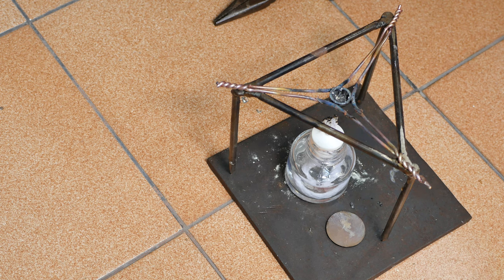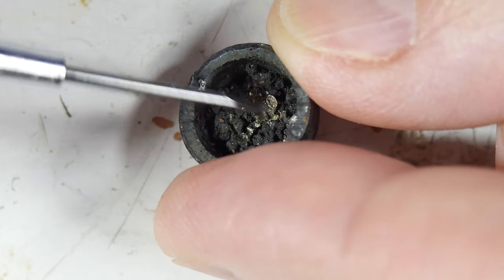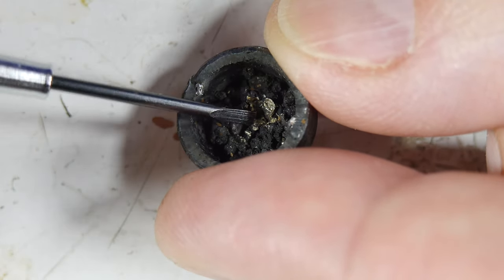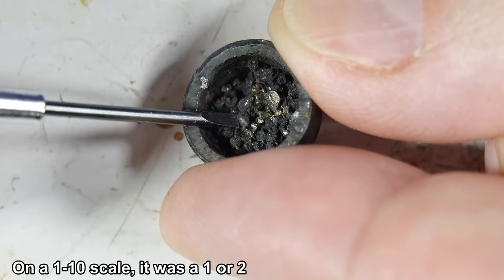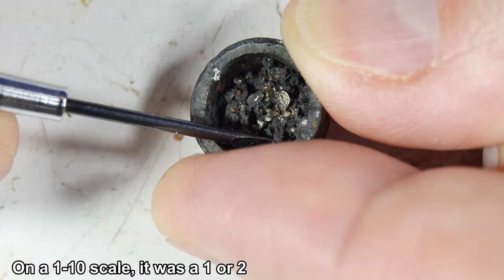We've got this mixture. It's been cooling. I don't know if it's cool enough yet. Galena grows in the ground very slowly, and I want to make sure that the crystals get to be as big as possible, so I'm just letting it go by itself. Well, we can see some metallic something right here, and I gave it a quick test on the crystal radio, and I can hear something. It's not great.